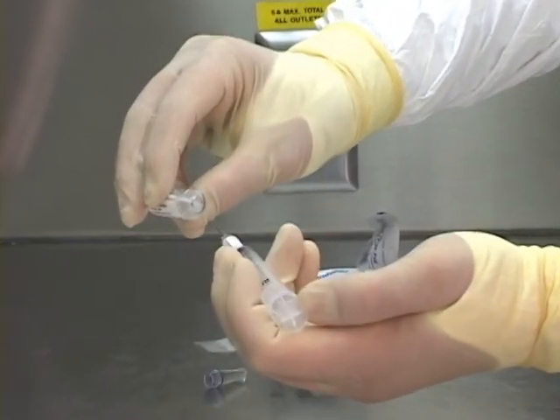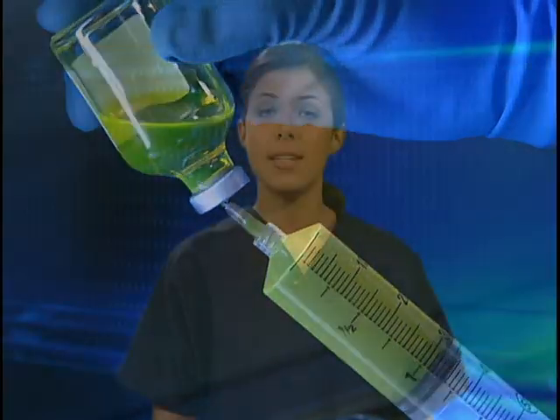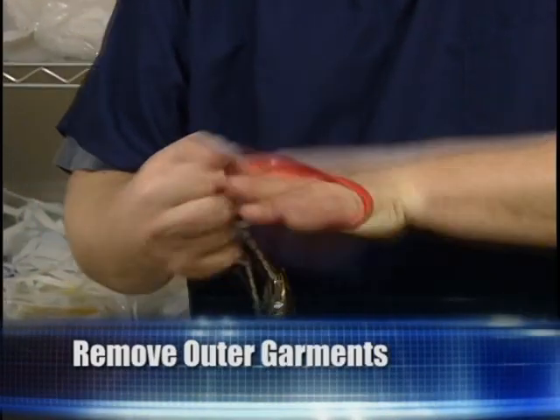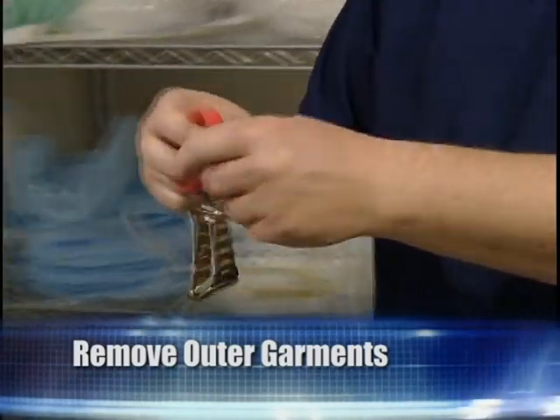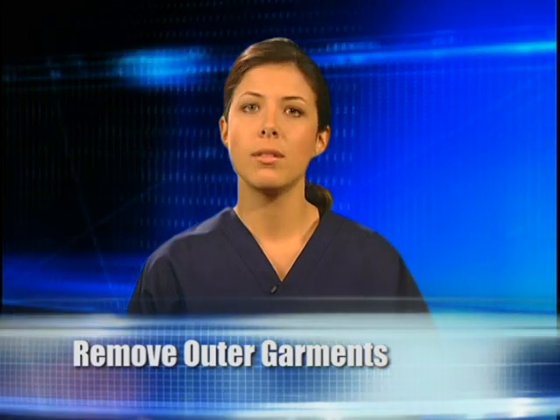While certain gowning standards are the same for all compounding practices, there are some with a few differences that apply when preparing non-hazardous and hazardous drugs. Standard gowning and gloving practices that should be followed by all pharmacy personnel include: remove outer garments such as lab coats, makeup, and any jewelry. Glasses are an exception and can be worn.